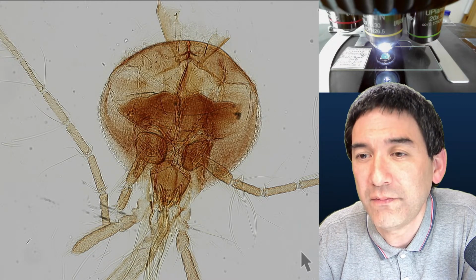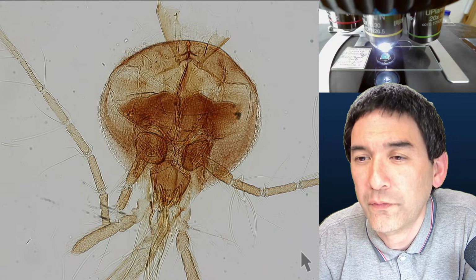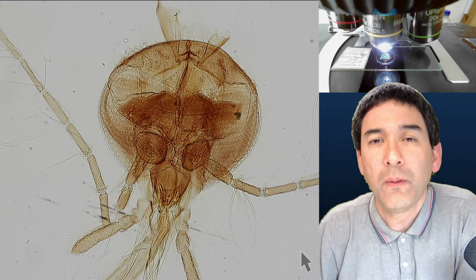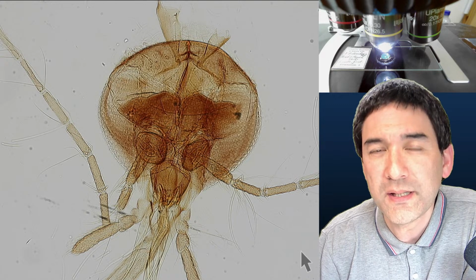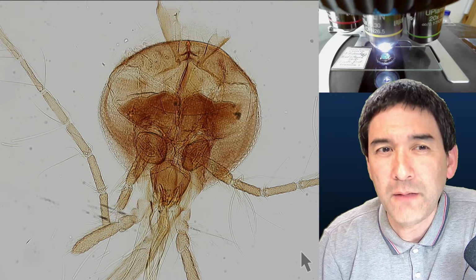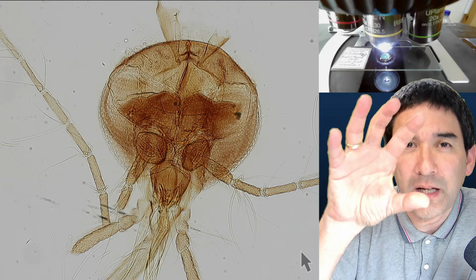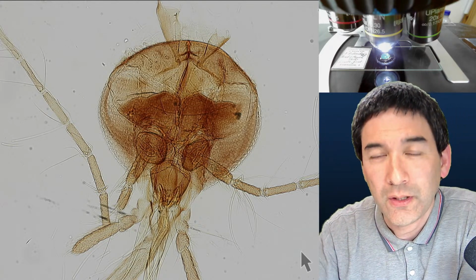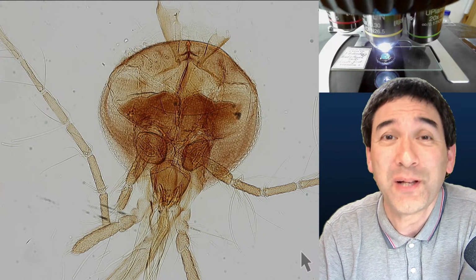The hexagonals are very clear on stitch 2. Can you make a camera move in this photo? So basically, I guess what you assume is the following: if you have a large photo in a video, is it possible to pan over the photo? And the answer, if this is what you mean, is clearly yes, and this is what I'm doing for my videos.